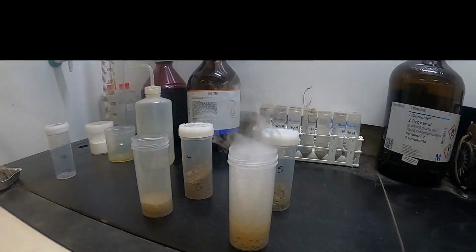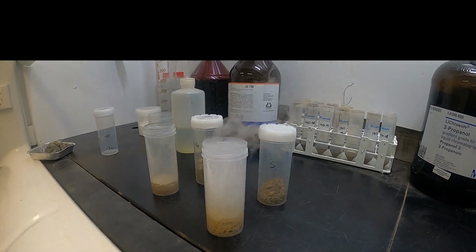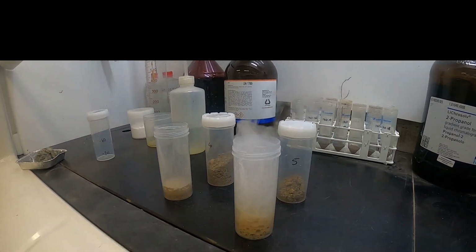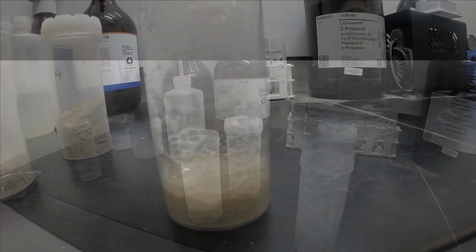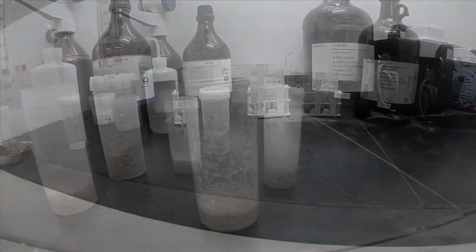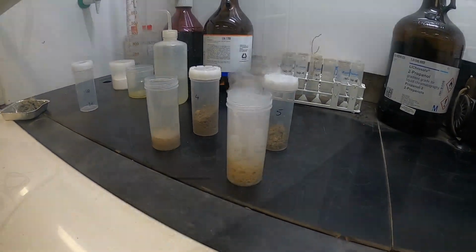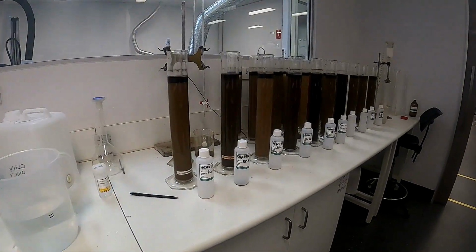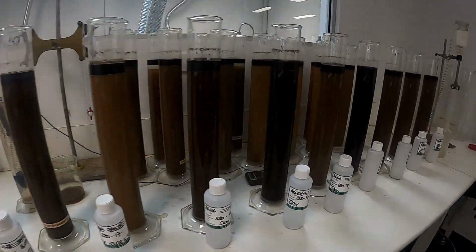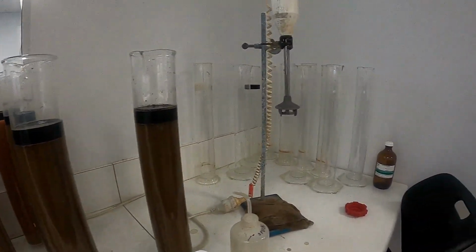This test is the acid sulfate soil field test and can be done either in the lab, as it is here, or preferably by the consultants out in the field. Here we're adding peroxide to a soil sample and we rate the reaction and the pH. It's a quick screening test. We also test soils for clay by hydrometer. Clay is a NEPM requirement on a proportion of soils.